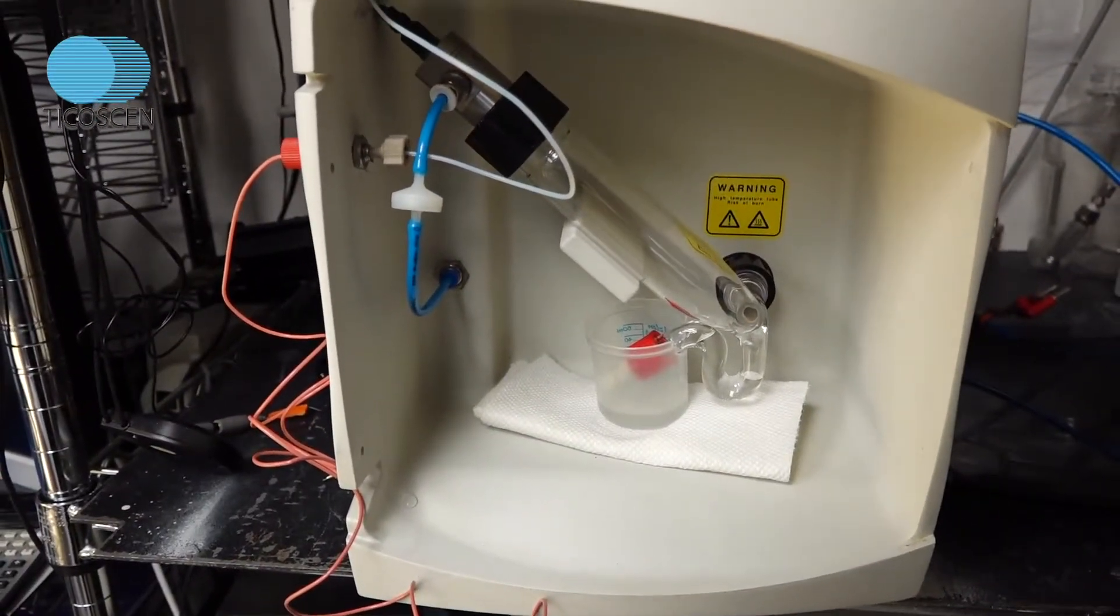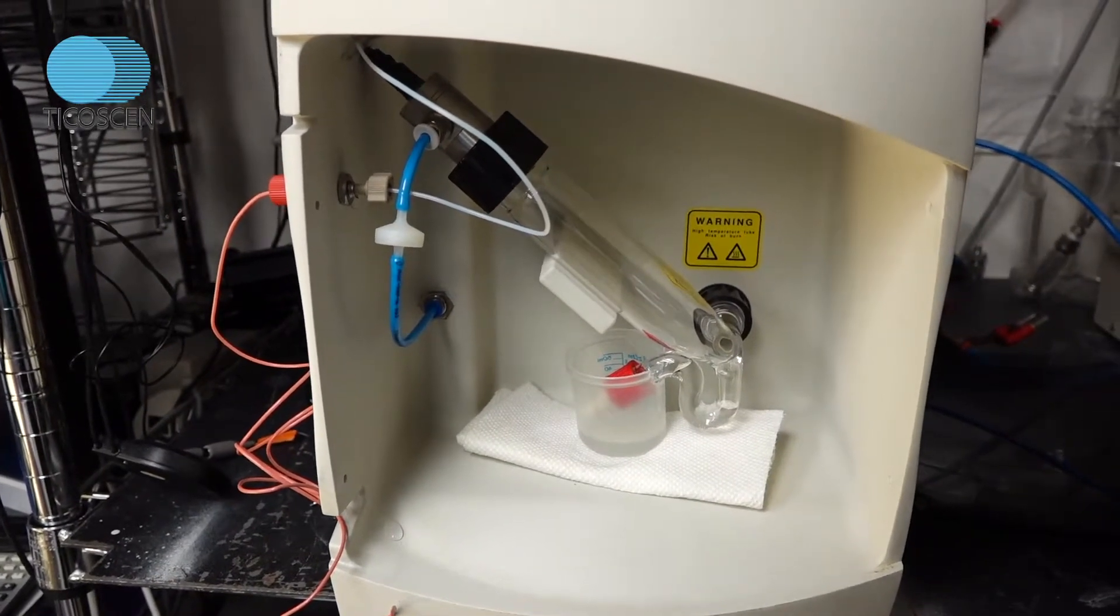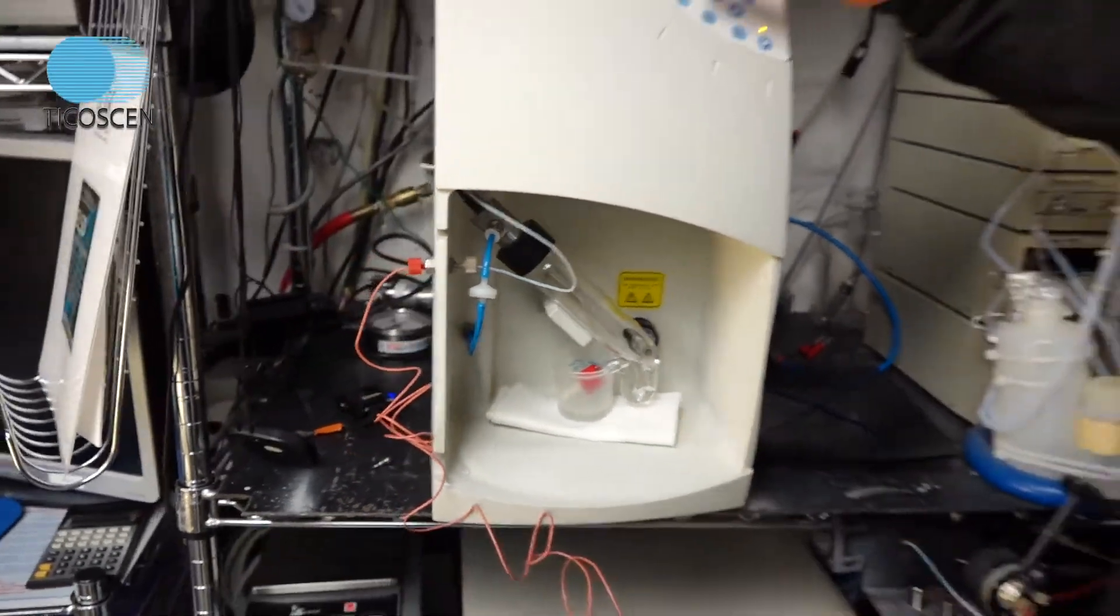So as the water goes through the detector and this heats up to 100 degrees C, you're just going to let this run overnight and steam clean itself. There's no fast way to do this. It takes time.